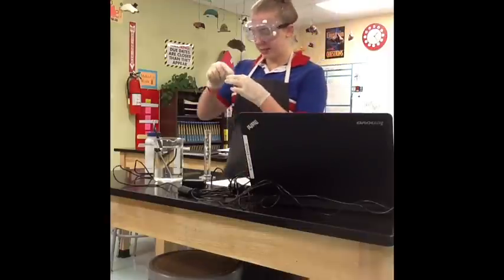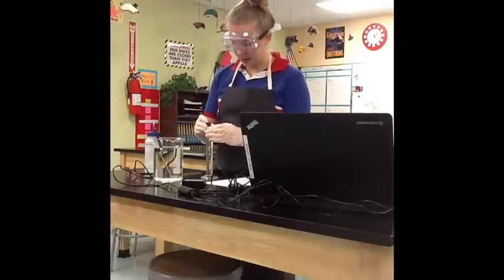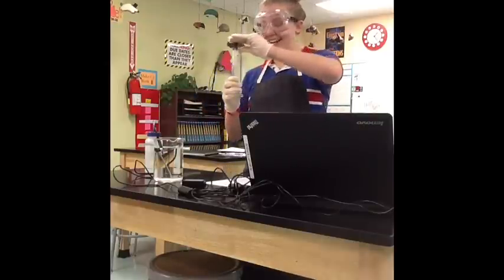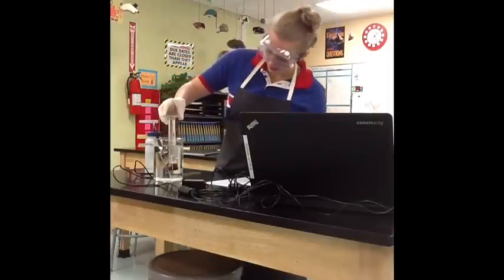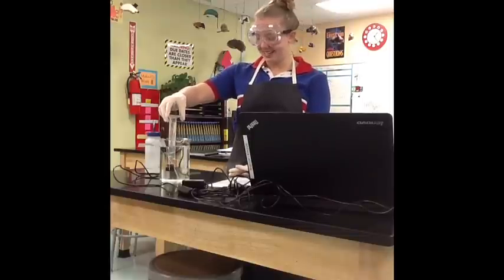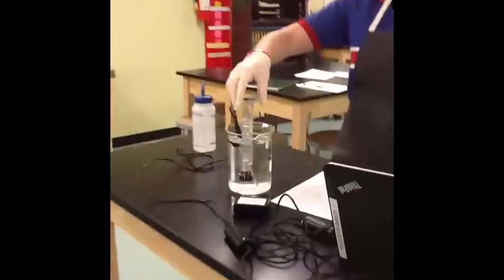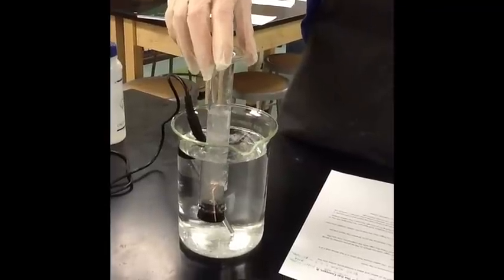Next, you are going to suspend your magnesium strip in the water carefully, and place the stopper on top. Then you're going to put your finger over the top of the stopper and quickly put it into the water. Once it's in the water, you can lift your finger up, and you're just going to suspend it here. You can see that it is reacting and producing hydrogen gas.